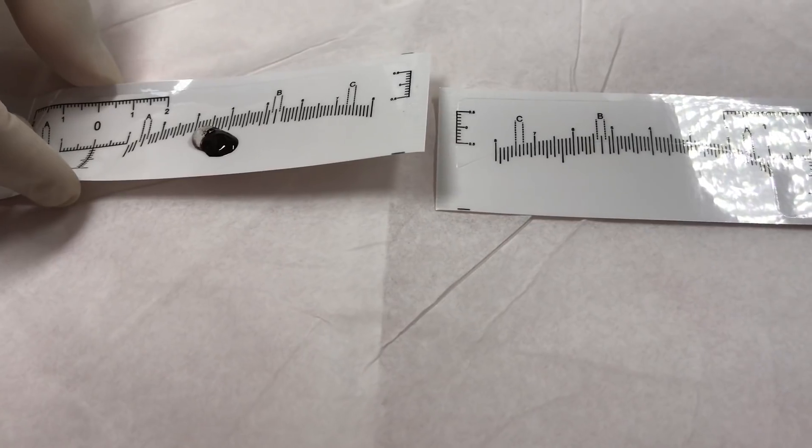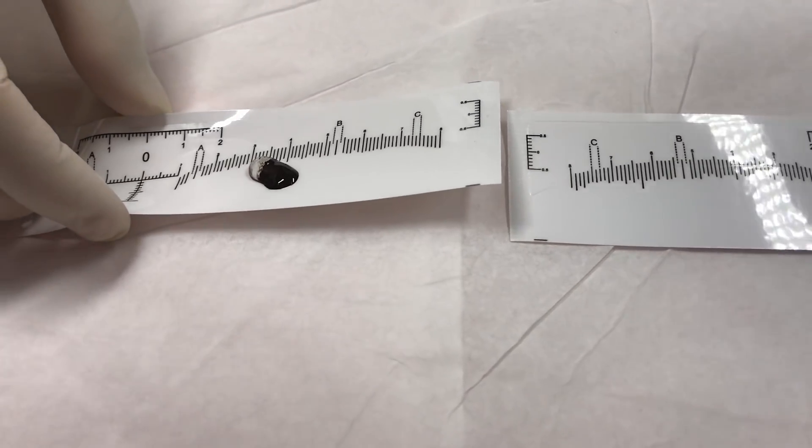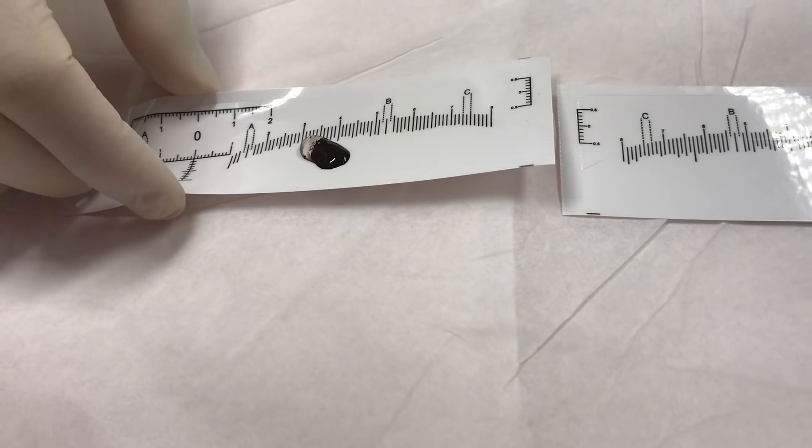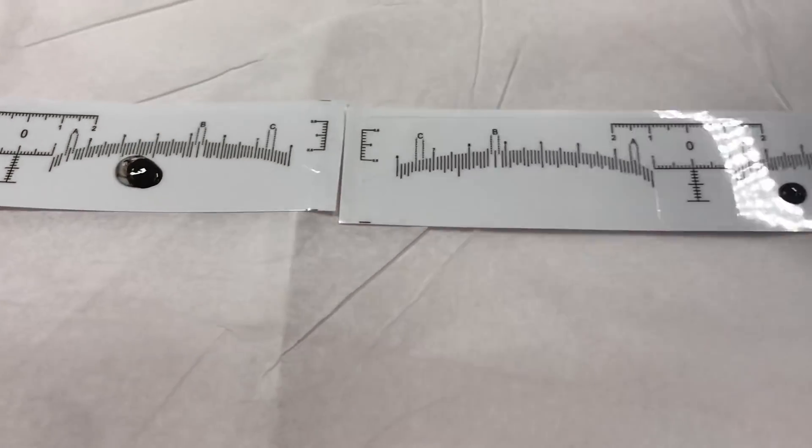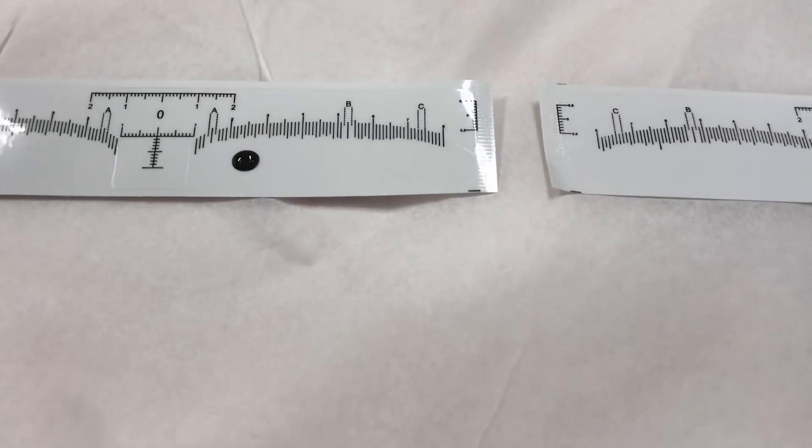You see the thin film on top? Very little. This one has very little iron oxide. So number one is okay — it has very little iron oxide.